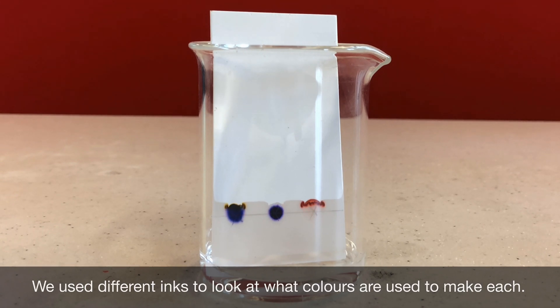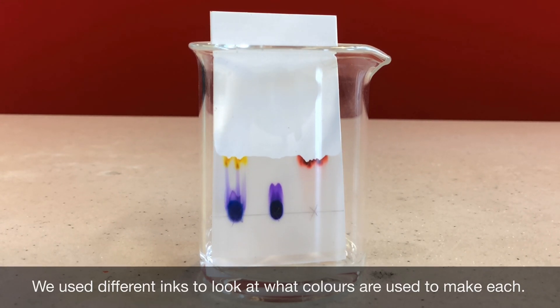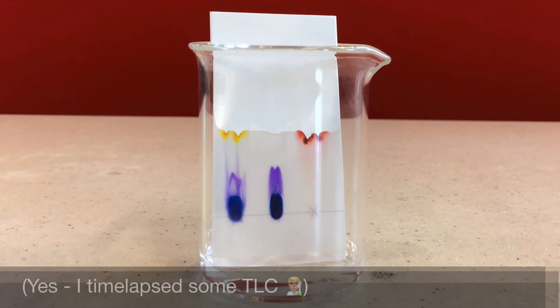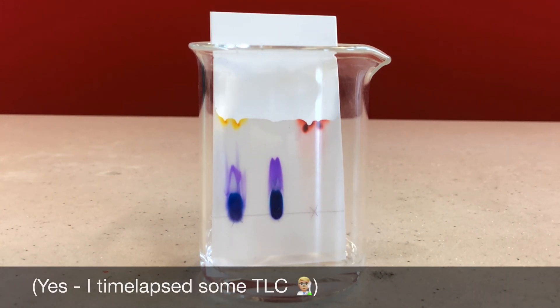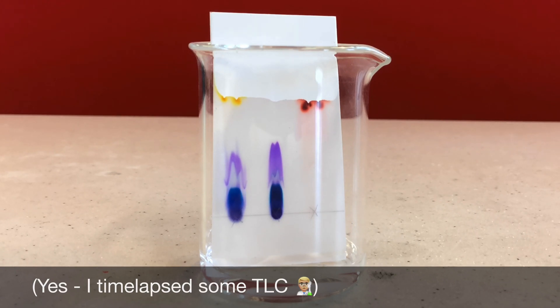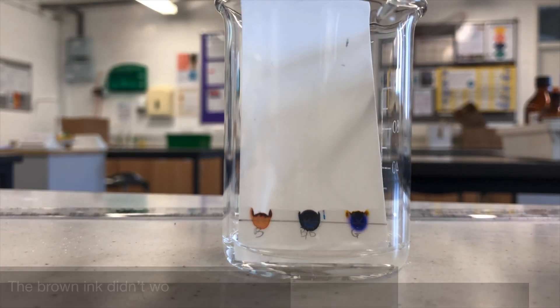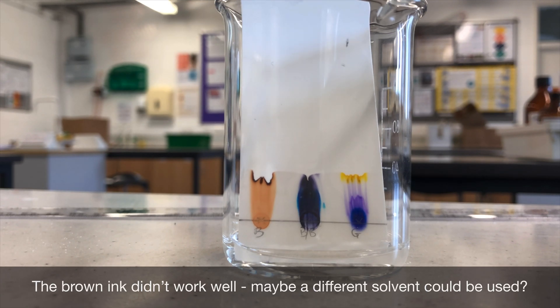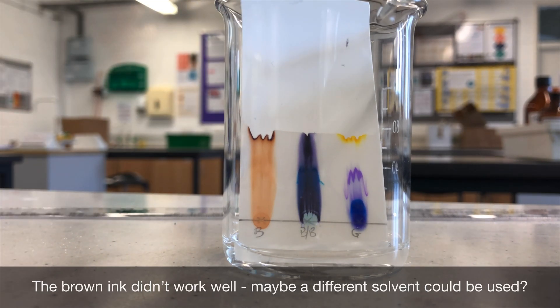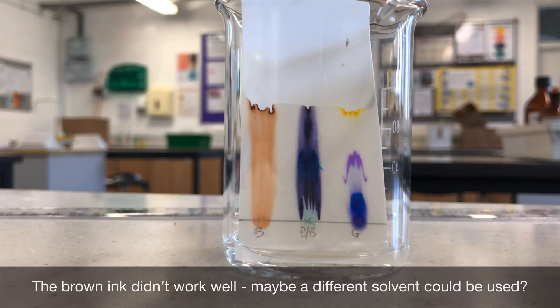What you can see on screen now is a time-lapse of a TLC plate that I ran. On the right-hand side there's a red component spot that moves up quite quickly because it was very soluble in the water. There's also a yellow spot on the left from a purple ink placed on the baseline, and other components of that same spot that don't travel very far — perhaps because they weren't very soluble in the mobile phase or were very attracted to the stationary phase. The brown ink spot on the left didn't travel well at all; I would try a different solvent to get a better spread.